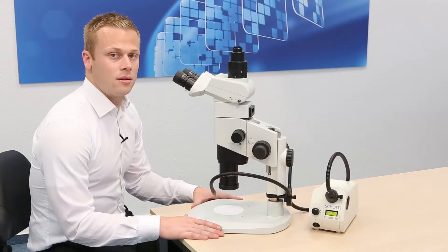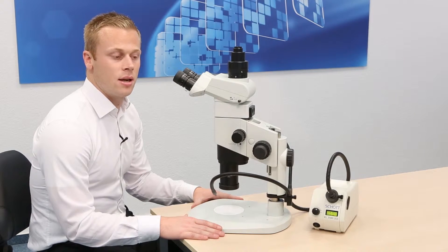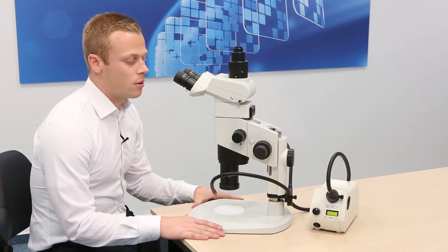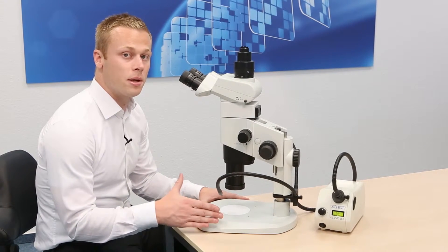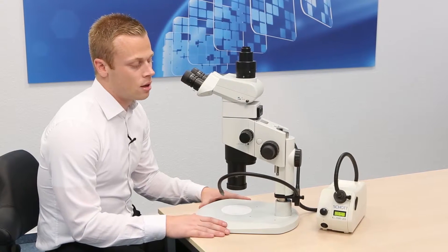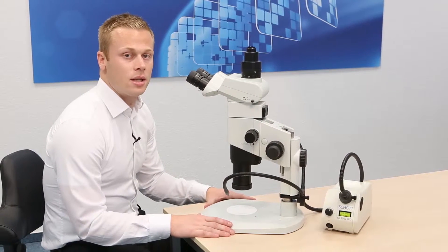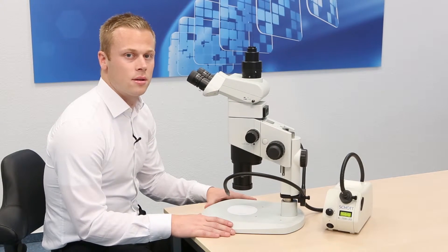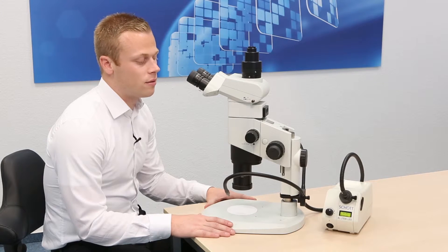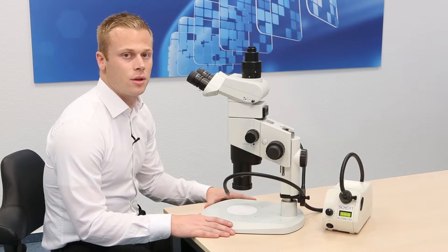Due to its slim design the KL2500 LED may be placed anywhere close to a microscope stand or a pillar, and its LEDs have a lifetime of at least 50,000 hours making it very easy to use and maintenance free for the user.